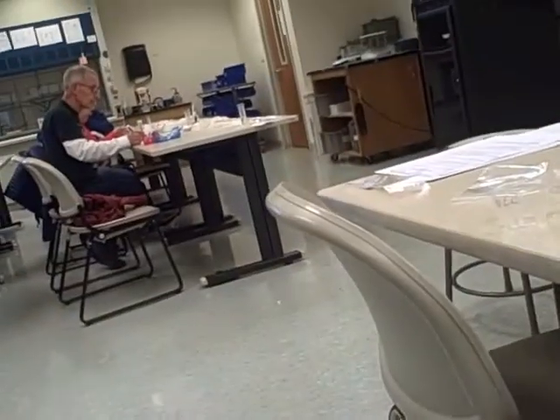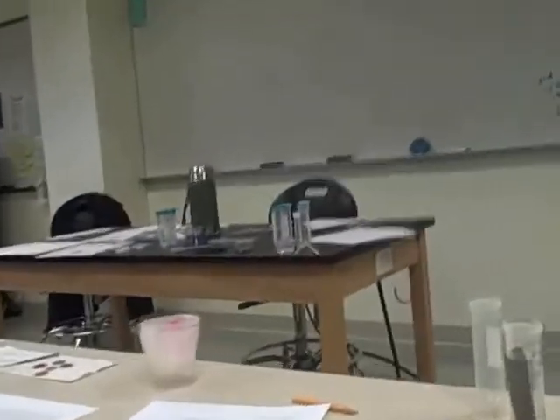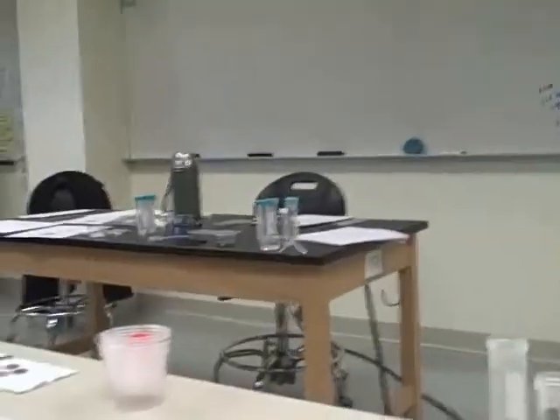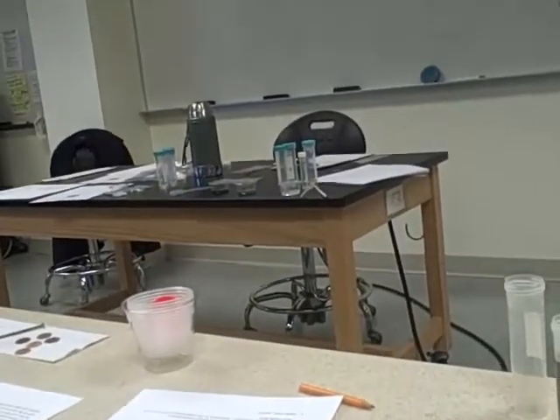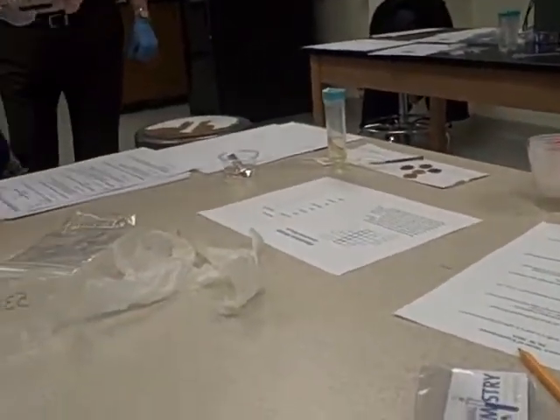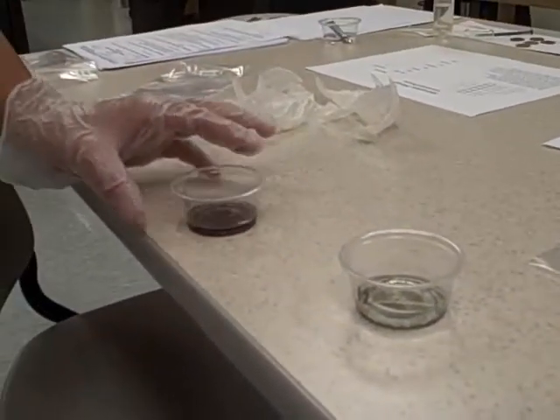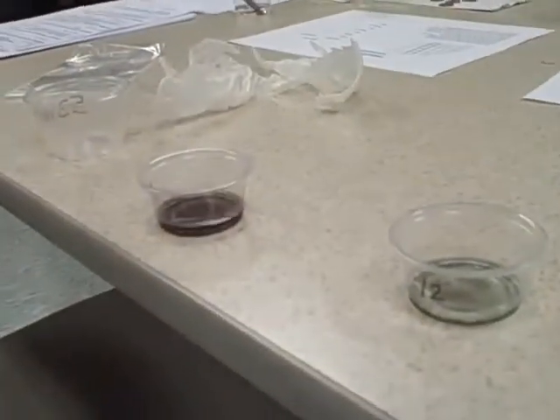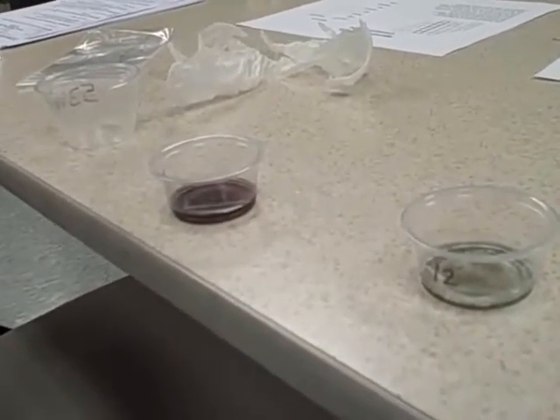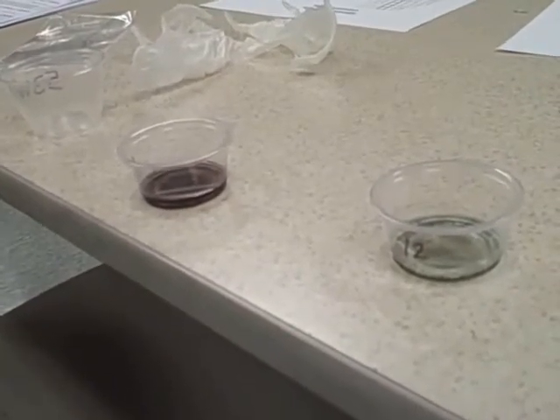Can you zoom in on the color change thing from the beginning? You can sort of see the blue, and you can see the pink too. Copper's gone back to blue, but it's precipitating out. And the cobalt is going back to pink. So those are experiment number 1. The script mentions that they could revert to original colors, and that's what's happening.